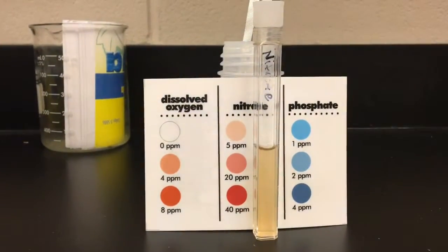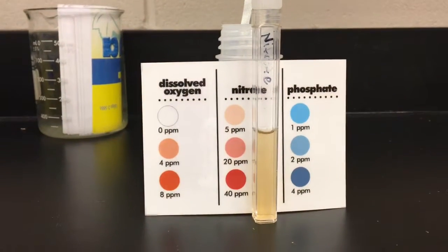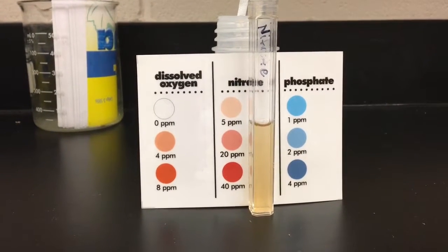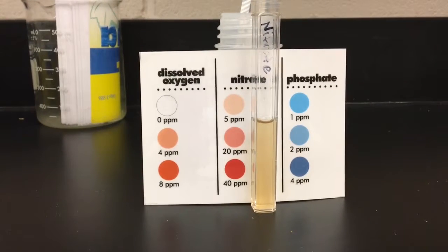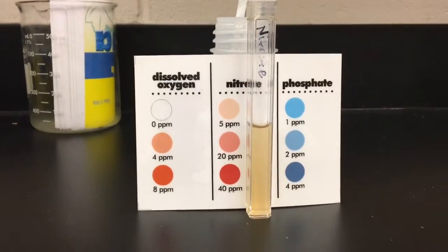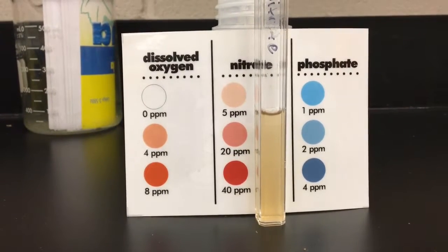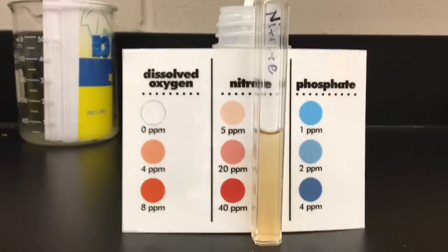The next test we conducted on our water sample from the fishing pond was nitrates. Nitrate is a nutrient that all aquatic plants and animals need in order to grow. Too much nitrate can overstimulate plant growth, especially algae. As the algae die, organisms that feed on dead algae use up all the oxygen in the water, which can kill other animals. This is also measured in parts per million, and comparing our sample to the color card, our nitrate level is about 5 ppm — maybe less.